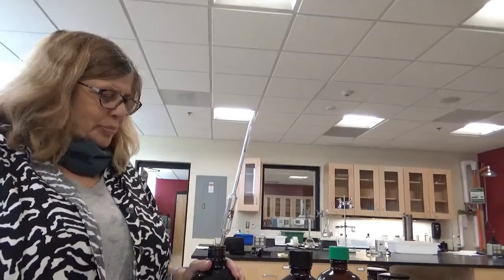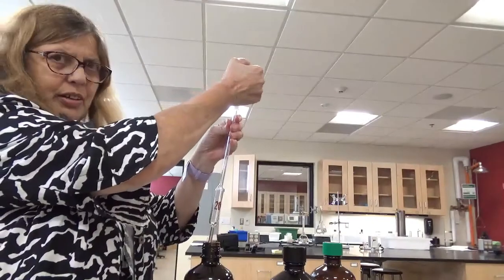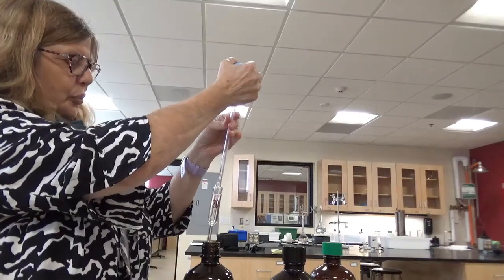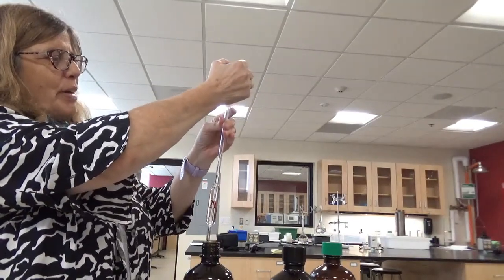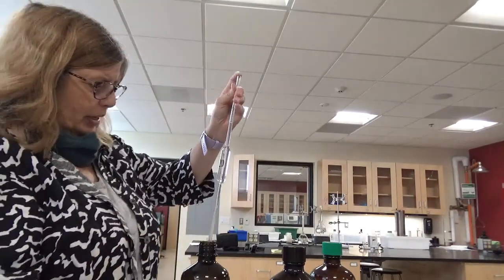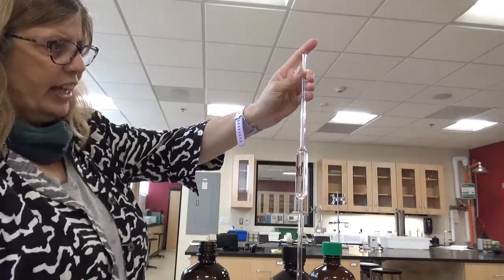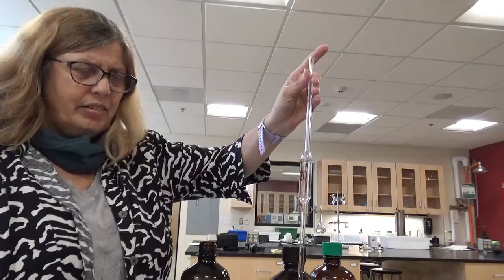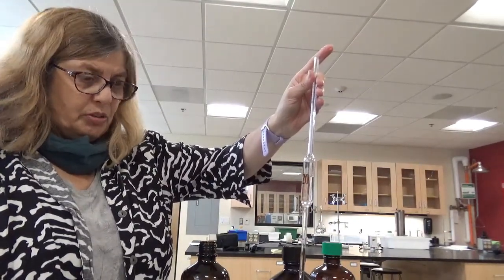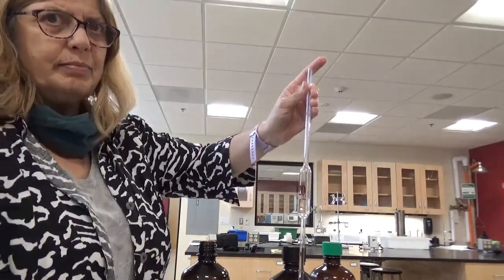It would be kind of silly for me to show you how to prepare all these solutions, but in the interest of showing you that I'm actually doing this for real, I'll show you a little bit of pipetting until it gets a little boring. So here I am pipetting 20 milliliters of the 2-naphthol solution into the first volumetric flask, and I'm going to put the same amount, this 20 mils of 2-naphthol, in each of the other volumetric flasks, and then I will continue with the other solutions.